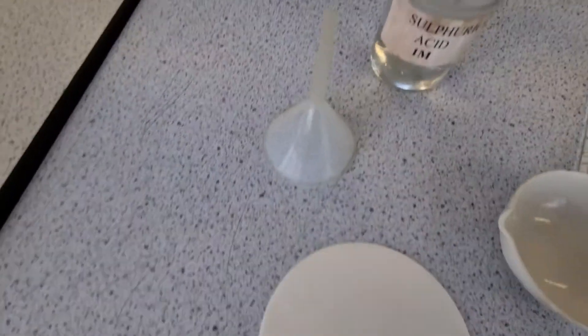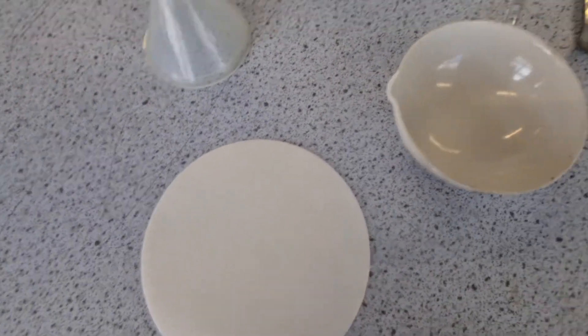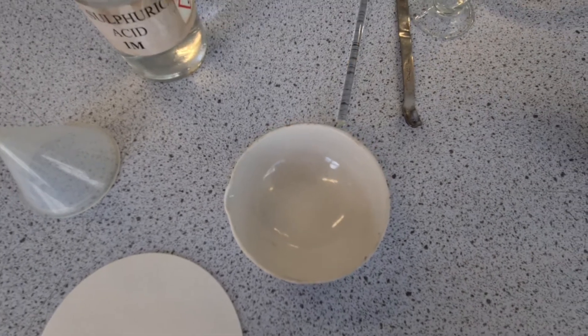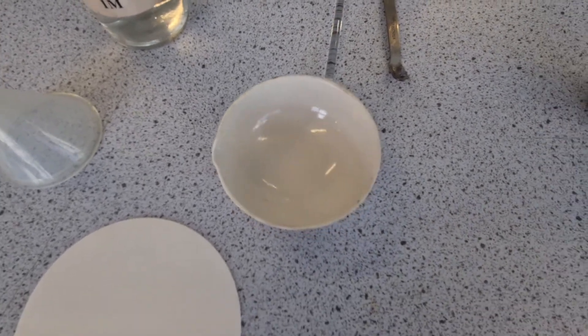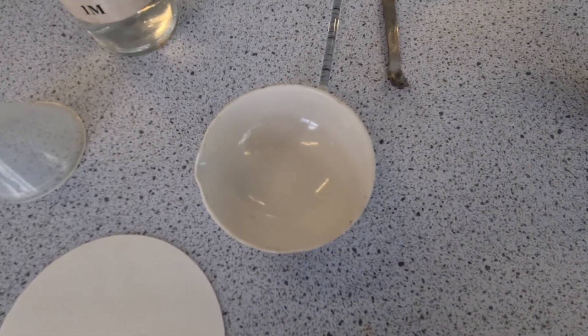I've got a funnel, filter paper. Last but not least, I've got an evaporating dish, which will be used to form the crystals later on.